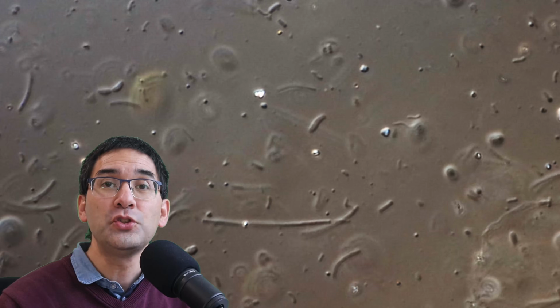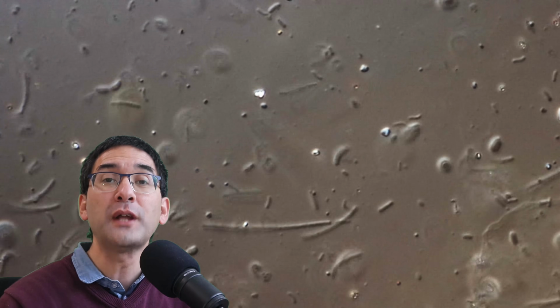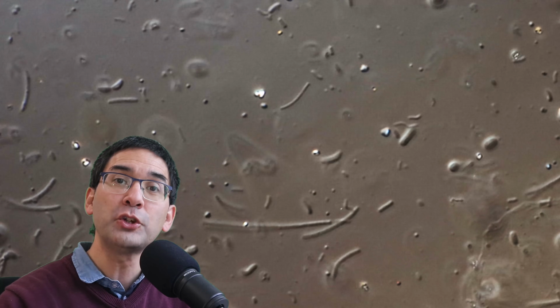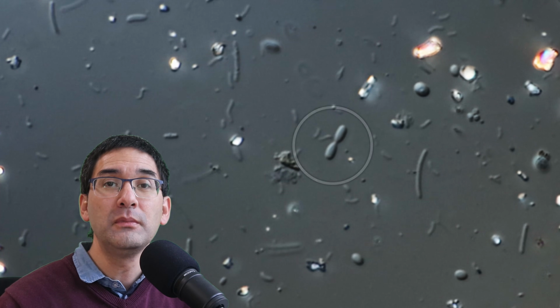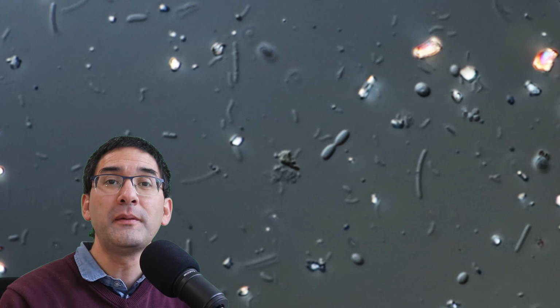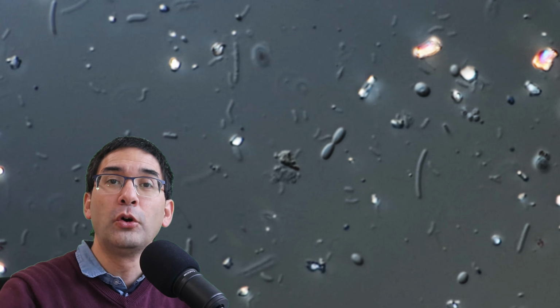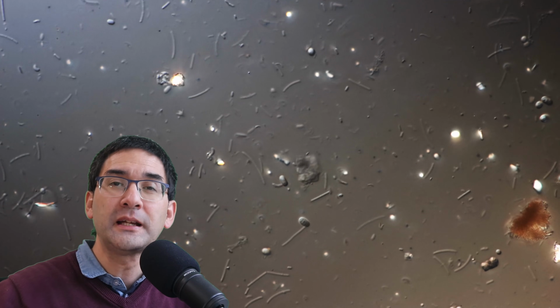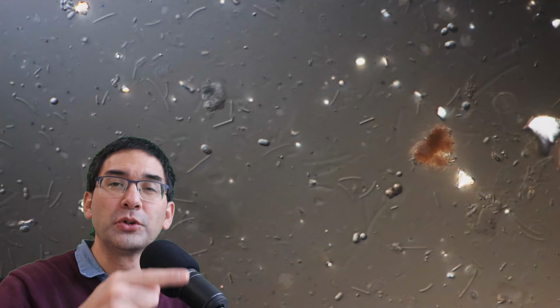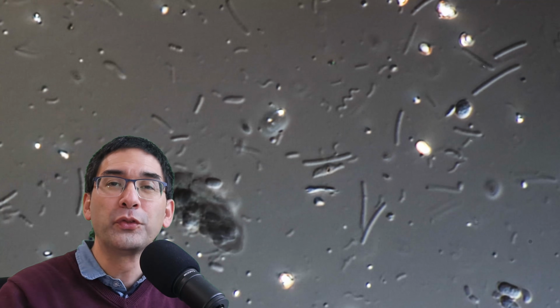Especially at higher magnifications, you're able to see that there are two different types of movement. Some bacteria wiggle around and they seem to have a directional movement, and they seem to be able to be pushed forward, and as a matter of fact they are, because some of them have so-called flagella. These are long protein structures that rotate like a propeller and push the cell forward. Others, the spiral-shaped bacteria, they turn in a corkscrew-like manner to move through the water.